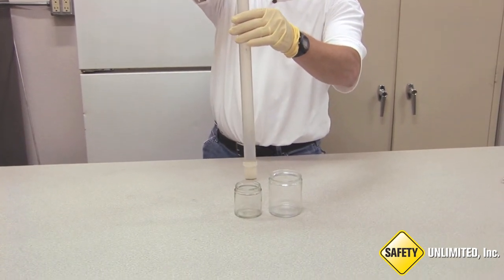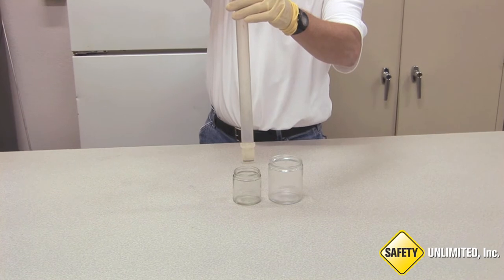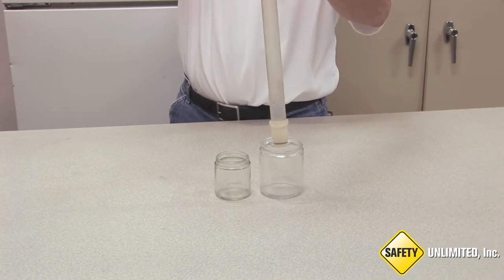When transferring the sample from the drum thief to a sample jar, be sure the jar is large enough to hold all the liquid from the drum thief.